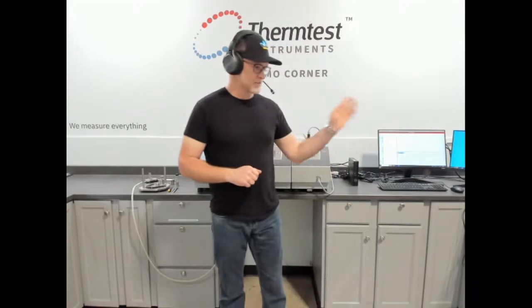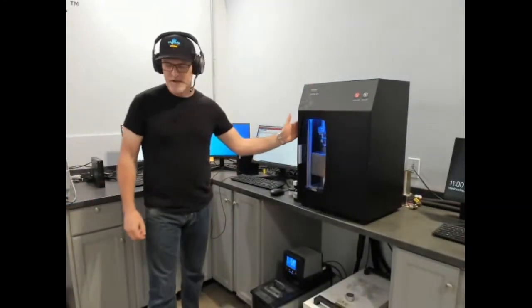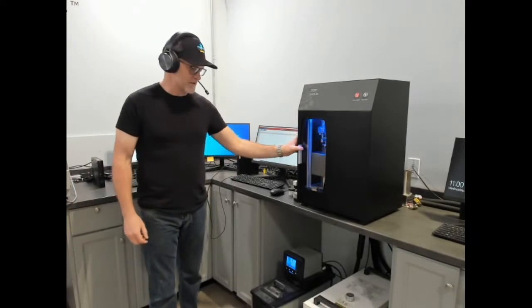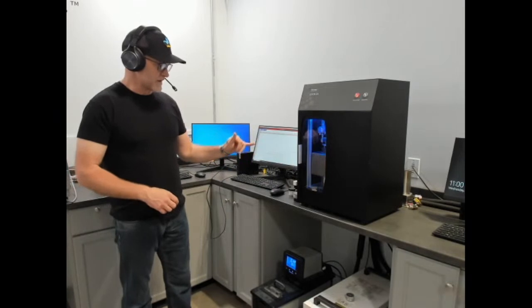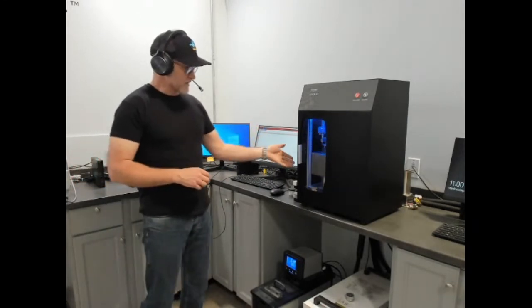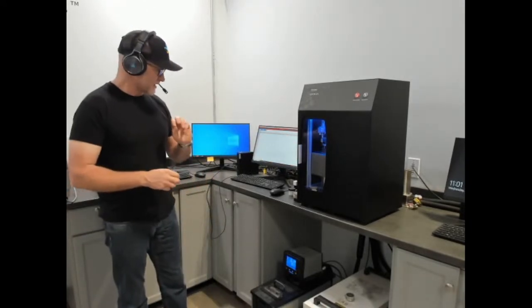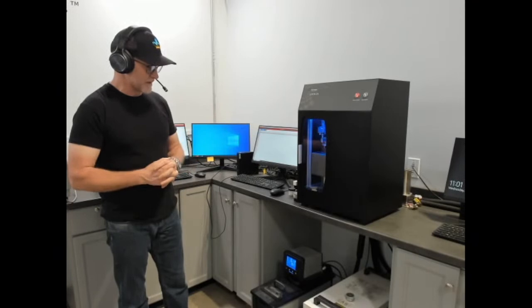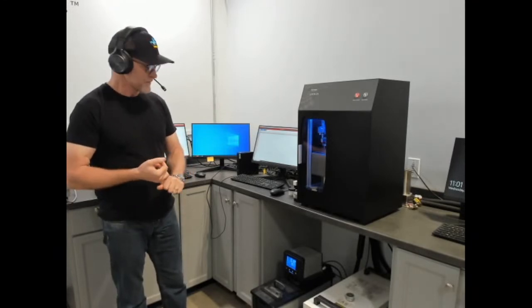So, to my left, your right, we have the guarded heat flow meter. This is following ASTM E1530 for measurement of thermal resistance and calculated thermal conductivity from -20 to 310 Celsius. Its real unique capability and where it shines is on the measurement of heterogeneous materials.